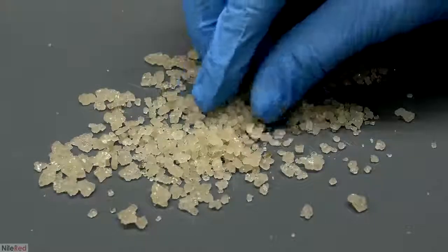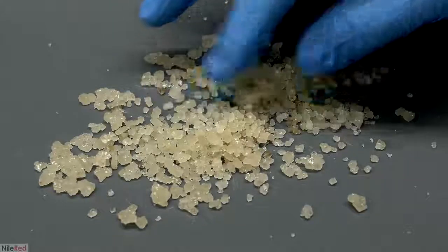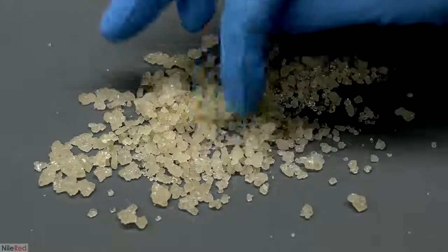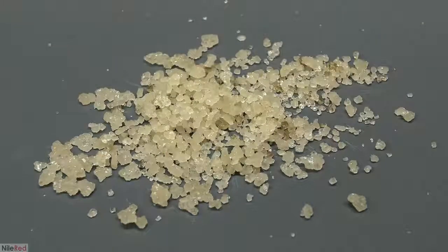To clean them up, I can crystallize them in water like I did before. However, this process is really slow, and I didn't really think it was worth it, considering I can just buy citric acid from the pharmacy.